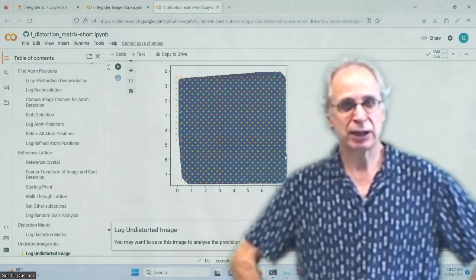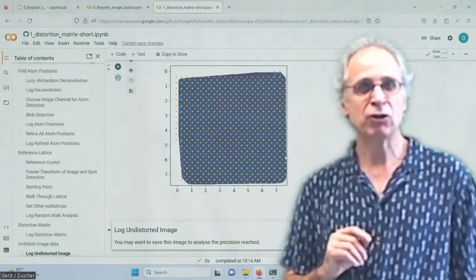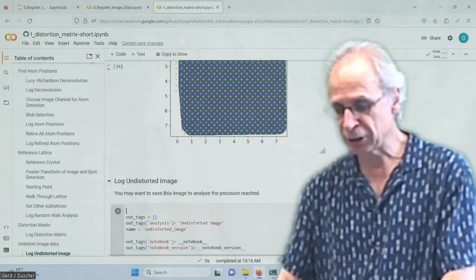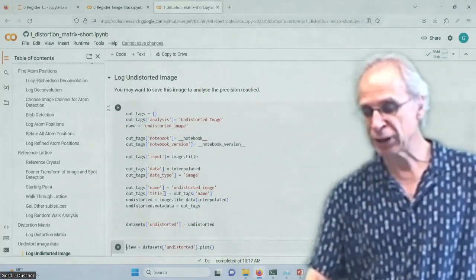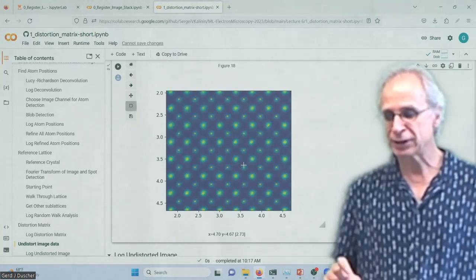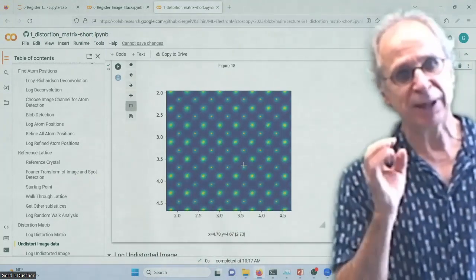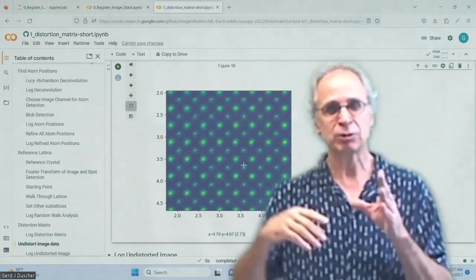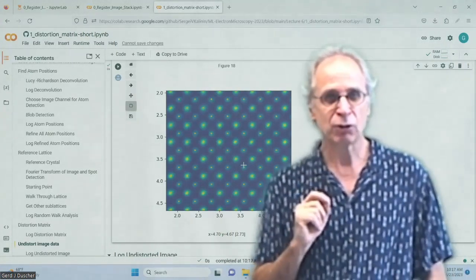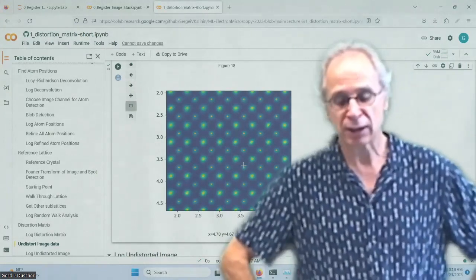This is something machine learning can probably determine for each microscope. What are the different deformation mechanisms? If you have enough data sets, then it can learn that. We can log this undistorted image, of course. There's not much value to it. Oh, one thing I forgot. I plotted the atomic positions of the perfect atoms. And so you see, there is no wonder that that is perfect, right? Because I'm using that to undistort it. And then, of course, they are at the right place. But it gives you confidence that all the undistortion was done and you didn't mix any of the different dimensions.